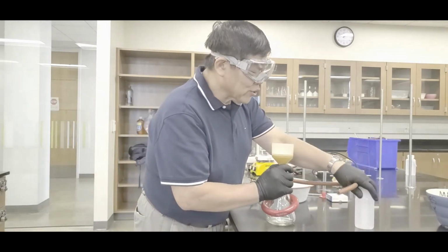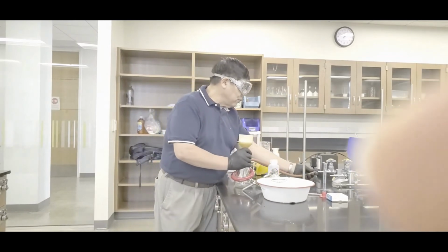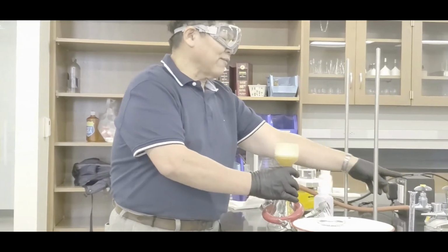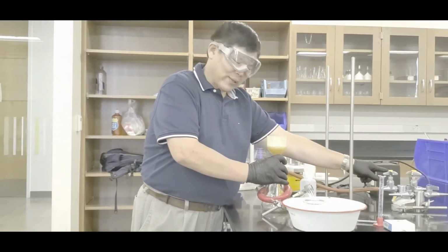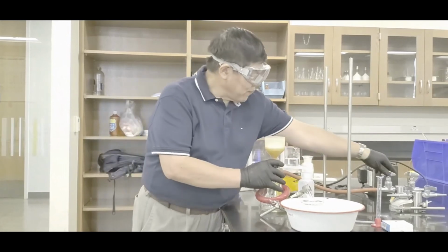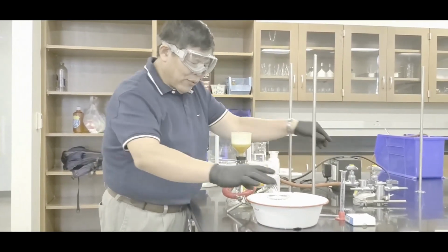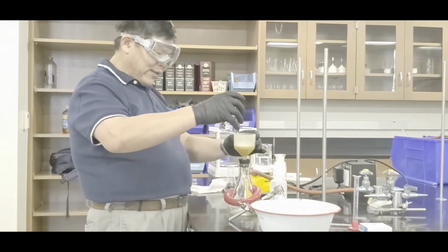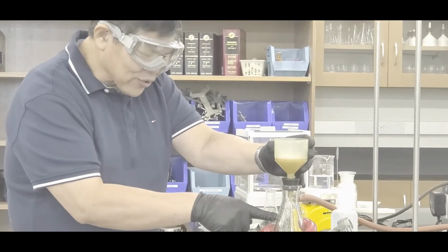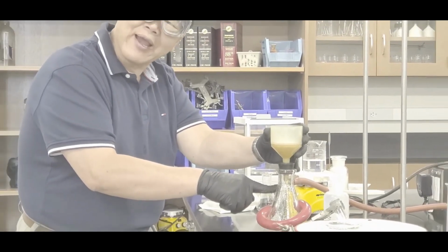And then take the squirt bottle with you, plug it into the valve, the spigot that has a vac, the yellow one. Now you're going to open up the valve this way, okay? And then pour a little bit of water in there. Oh yeah, okay? So you see the water squirting through? That tells you that the vacuum is okay, yeah?